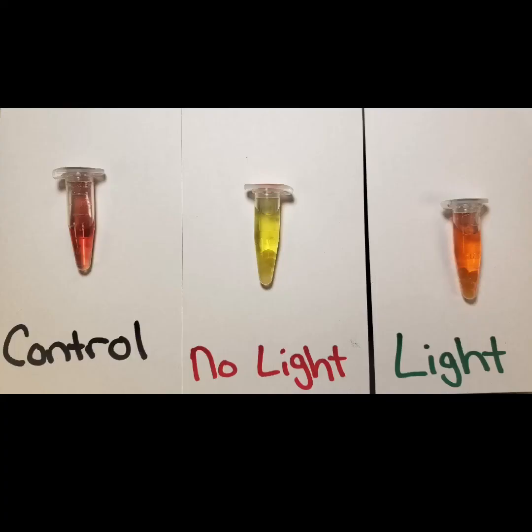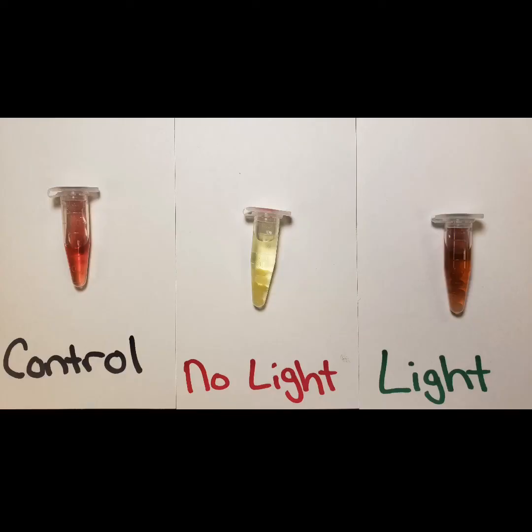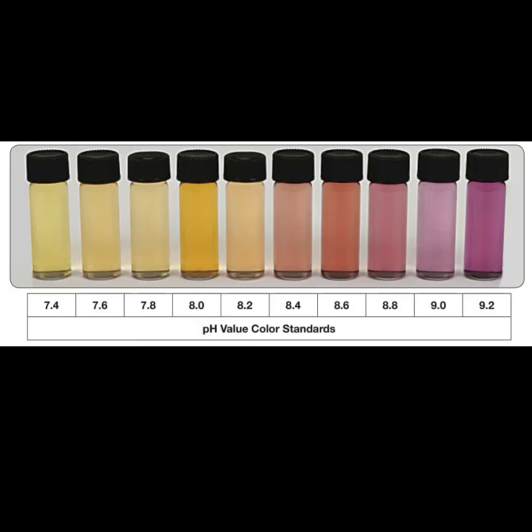Time, 20 minutes. Based on the coloration of the bicarbonate indicator solution, determine the pH for all 3 trials. Here are the pH value colored standards to help you make your observation. Time, 25 minutes. Based on the color of the bicarbonate indicator solution, determine the pH of all 3 trials. Here are the pH value colored standards to help you make your observation.